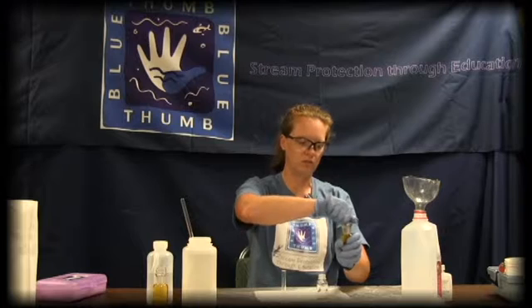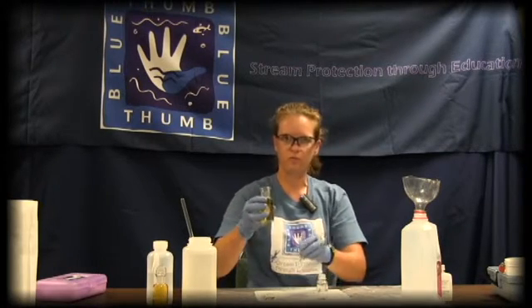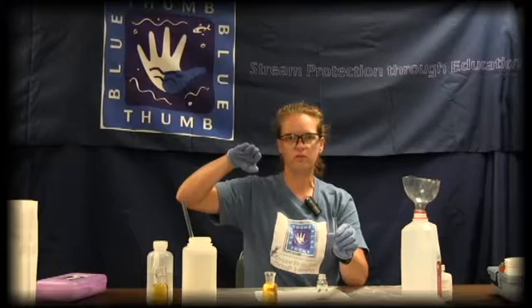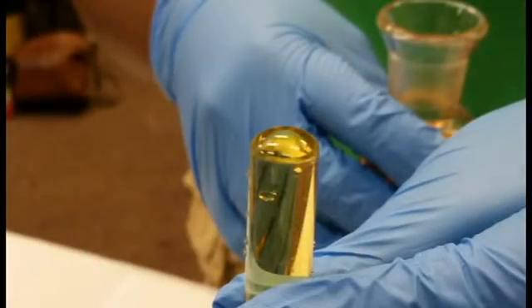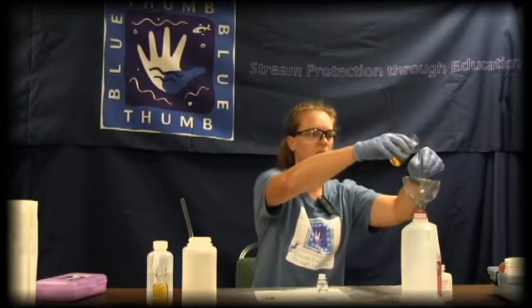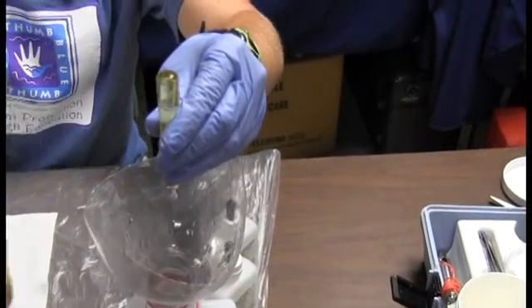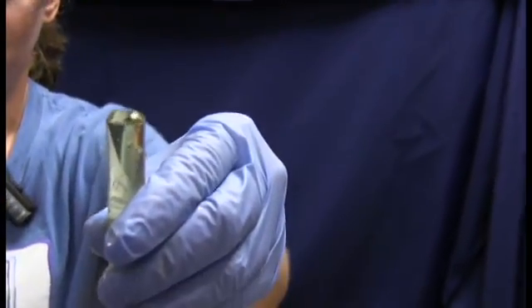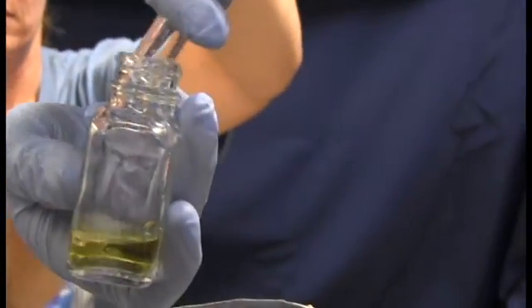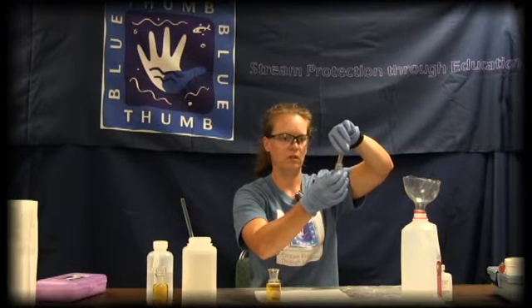Start with one dissolved oxygen bottle — go ahead and twist and pull on the glass stopper. Then pour from the dissolved oxygen bottle into the plastic measuring tube, and you want a reverse meniscus. A regular meniscus is the natural curve down of the water; a reverse meniscus is like a big bubble on top of the plastic measuring tube. I usually hold the tube over the liquid waste and over-pour to get that big bubble. Then get all of that into the square mixing bottle by touching the equipment together and pouring as a unit, then shake the tube to get any remaining drops.